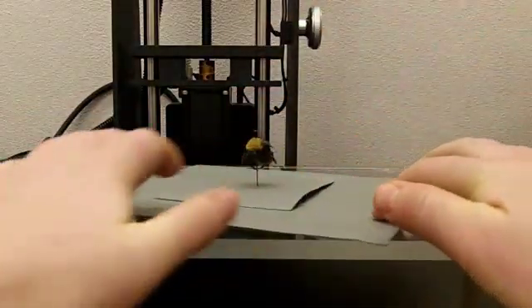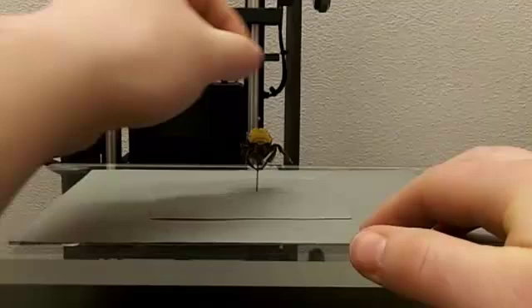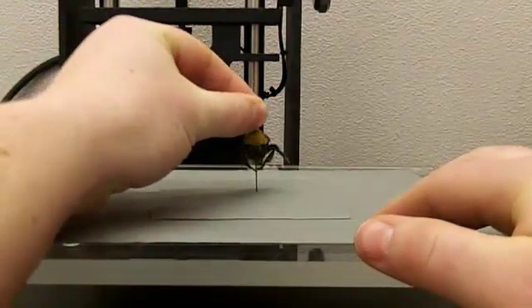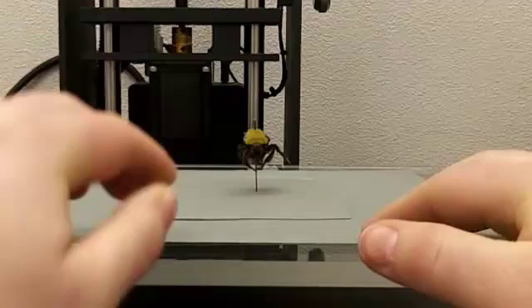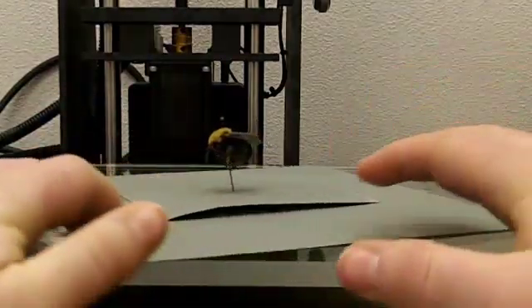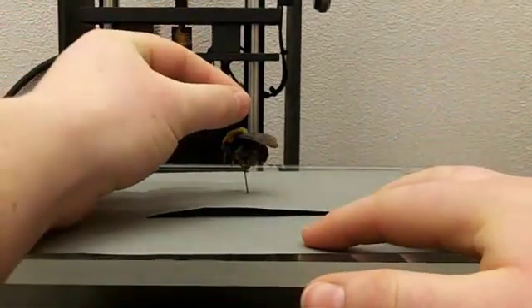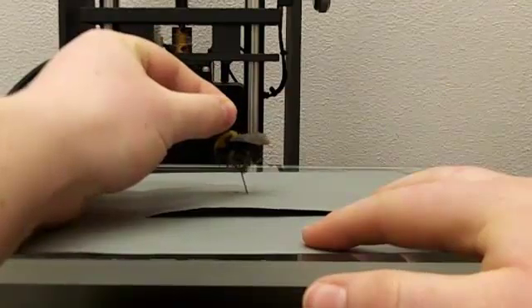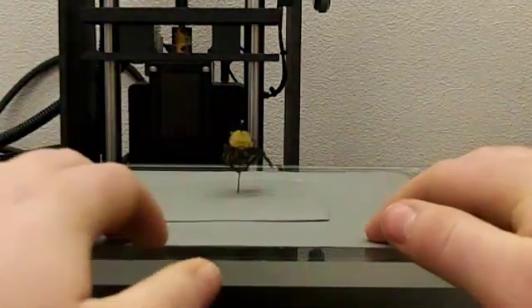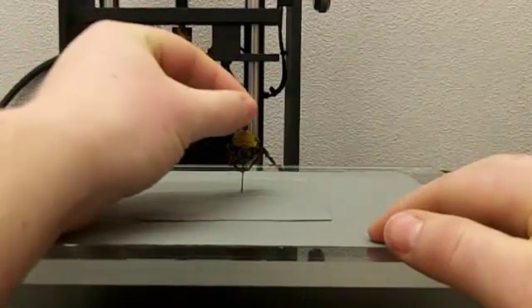Next, you need to line up the specimen so that everything is level. So you look at its face and that's pretty level. Next, you look at its side and you line it up. And then you check the face again and it was moved.